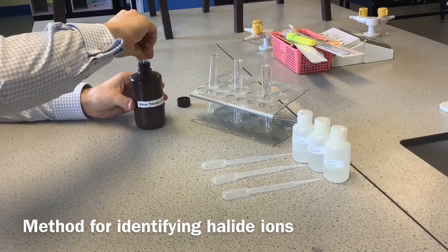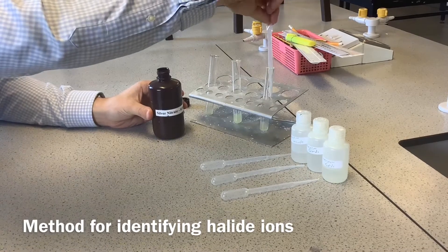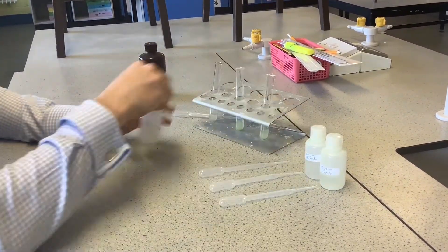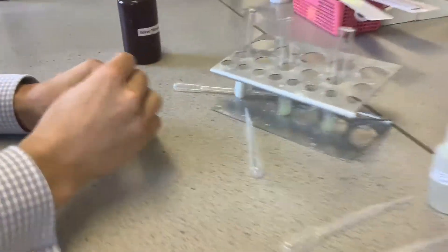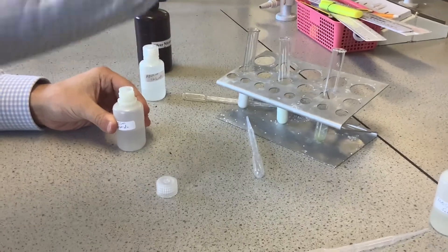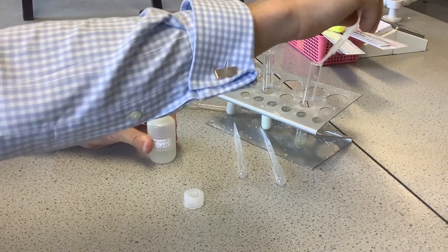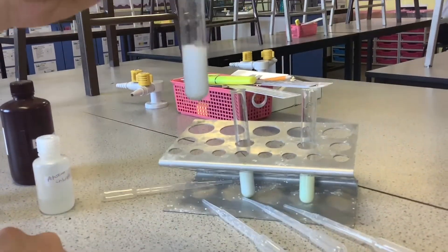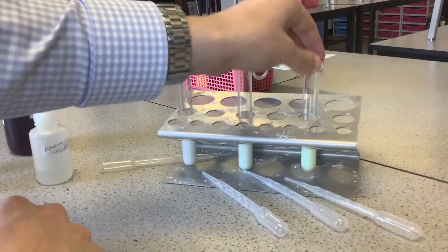I don't need an awful lot of silver nitrate, just enough. So I've got three test tubes. I'm going to add some of my solution — first I've got chloride, so I'm going to put a drop in there. Then I'm going to do bromide. And finally iodide. So we've got our chloride — that turns a white precipitate, and I know it's a precipitate because that's a solid produced. Then my bromide — it's a cream one, slightly darker. And finally my iodide, which is a yellow one.